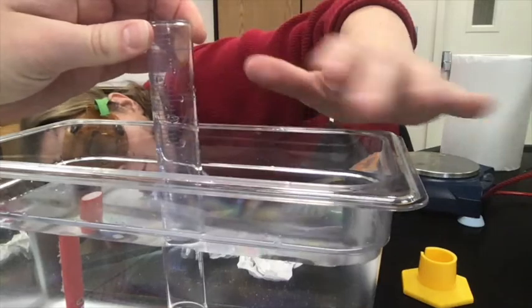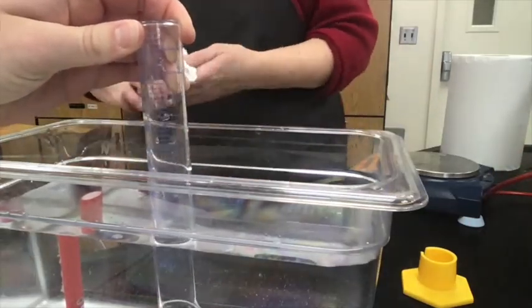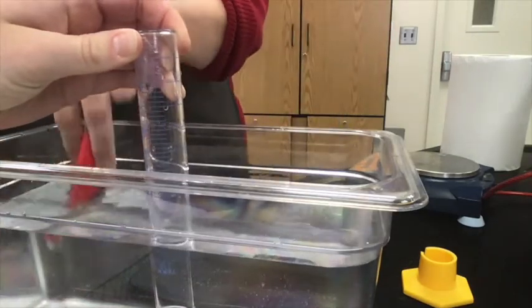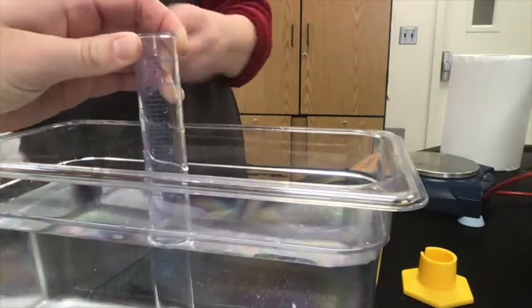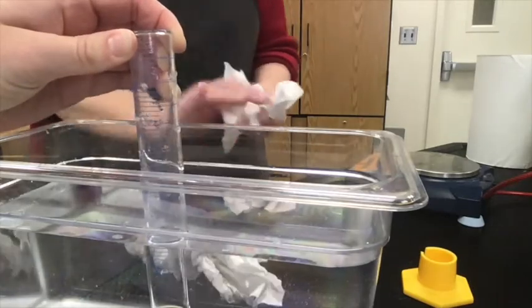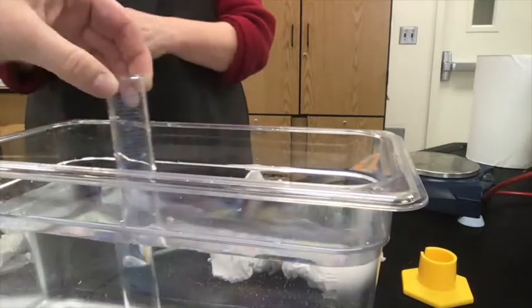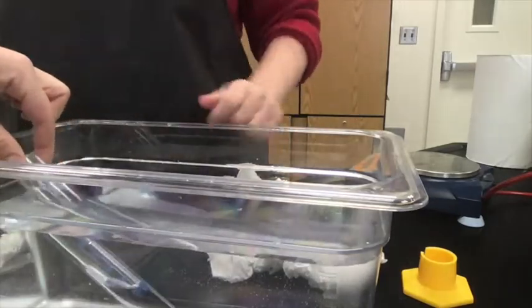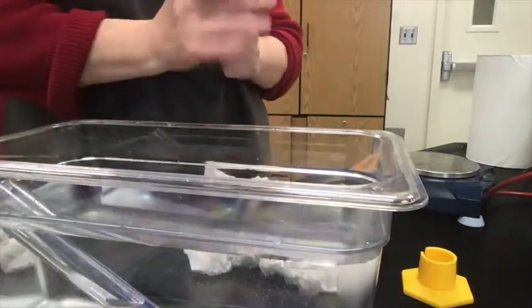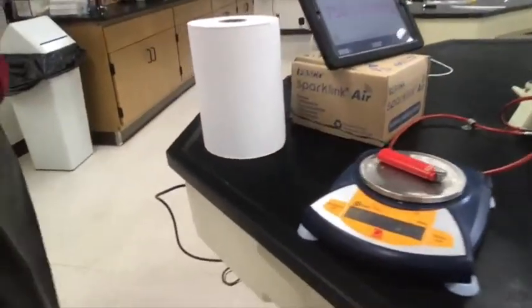Okay. I think it's below 45, like it's 46 something. I would say it's, oh wait, that's 45. That's about 46. It's about 47.0 actually. Okay, let's go 47.0. So we're not writing that down for you, but you're writing it down. I can drop that now that we got the volume. So that is the volume of trial 2, and we're going to now get the final mass of trial 2.